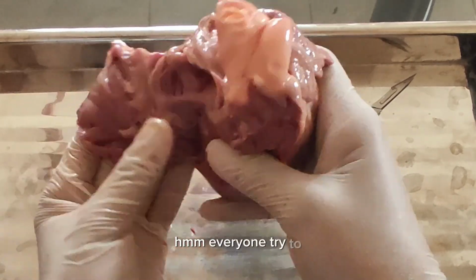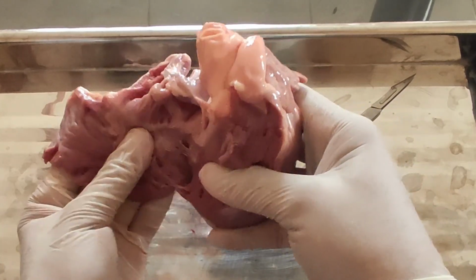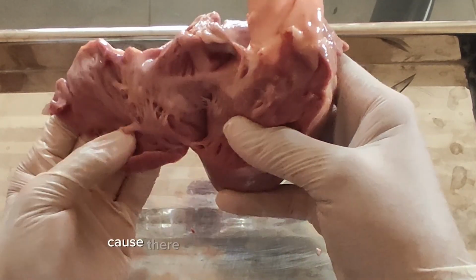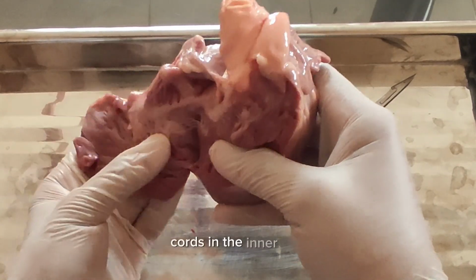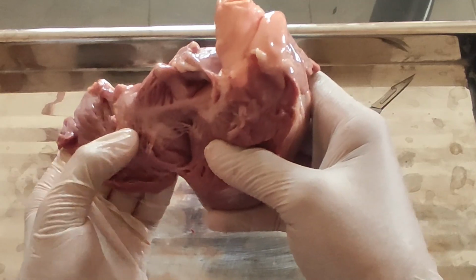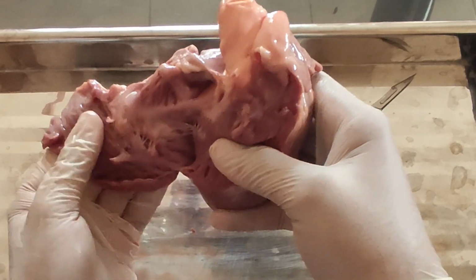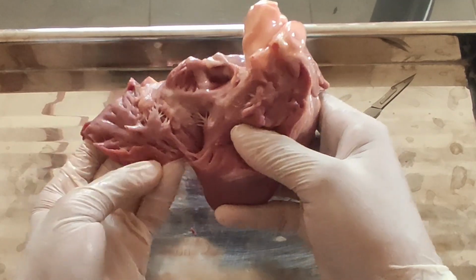Everyone, try to feel the thickness of this right ventricle right here, because there are a number of irregular muscular cords in the inner wall of this chamber. There are the cords right here. This one. The cords. Now find the septum on the right ventricle.